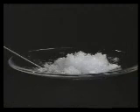Place a small amount of solid in a test tube. Add about 1 milliliter of test solvent. If the solid dissolves immediately at room temperature, the solvent is not good for recrystallization. Repeat with another test solvent. Place a small amount of solid in a clean test tube, then add about 1 milliliter of the different test solvent.